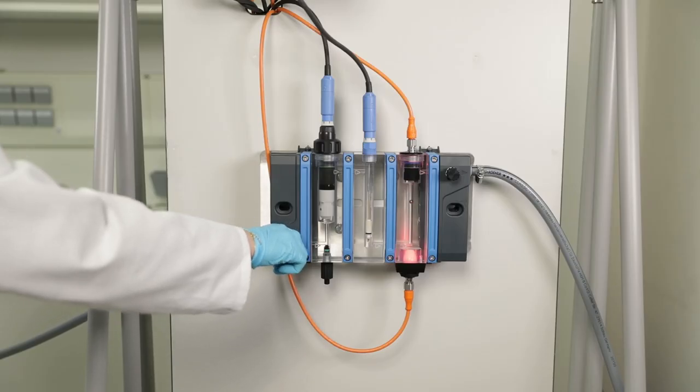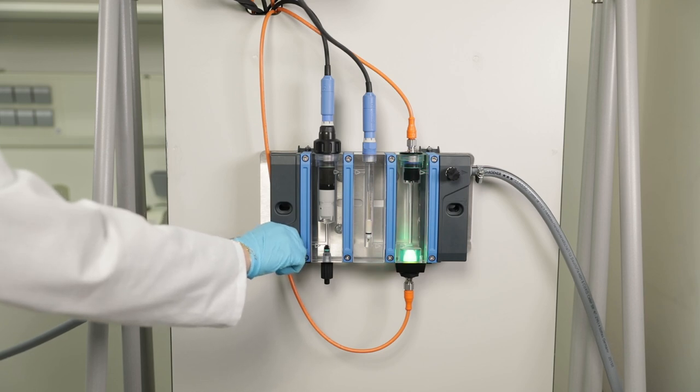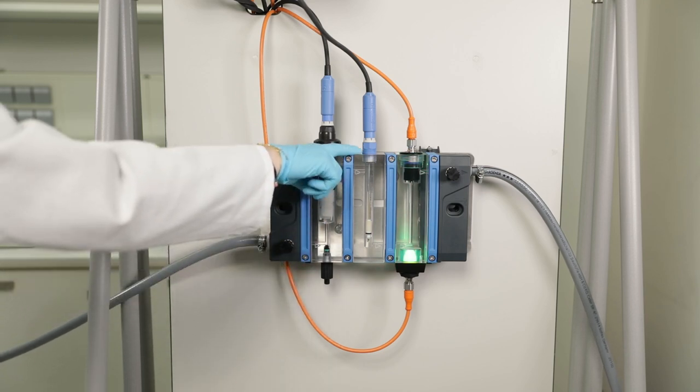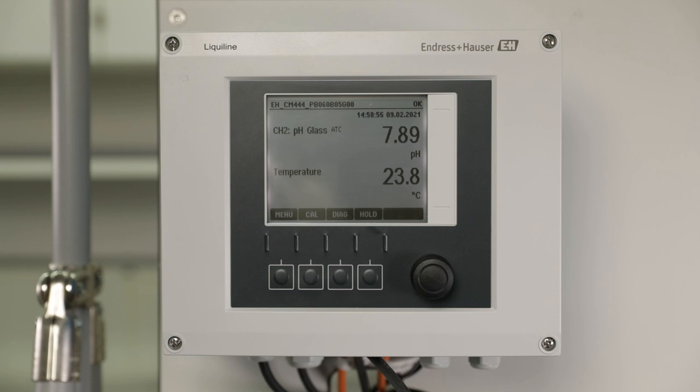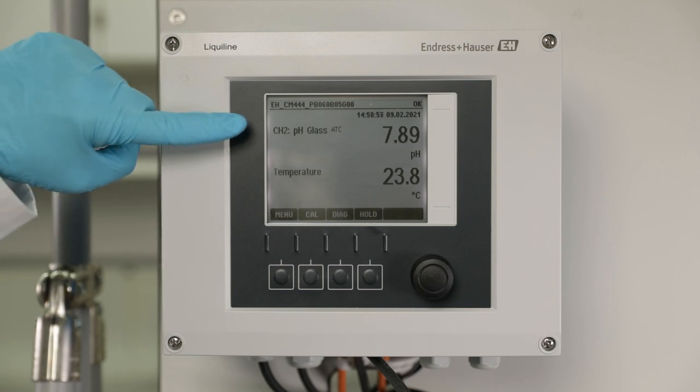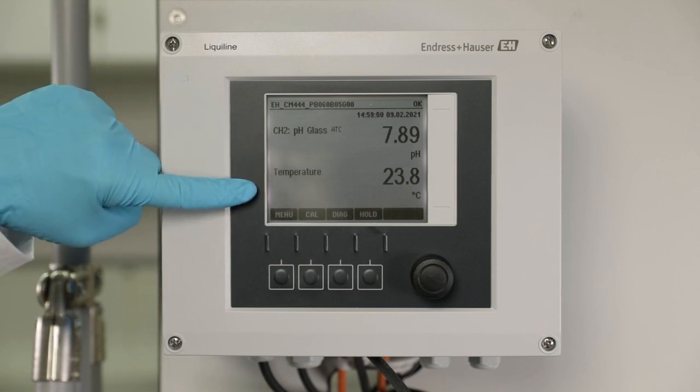Restart the process and check for leakages. Check the on-site measuring instrument for correct pH and temperature readings.